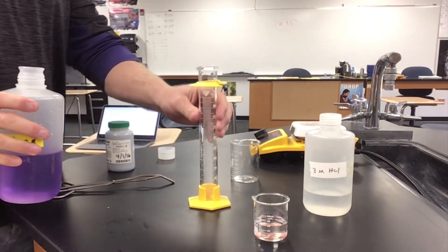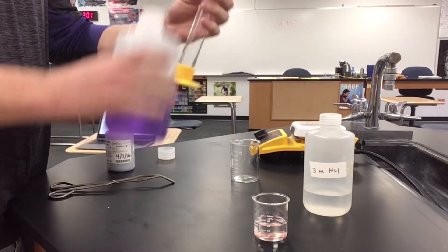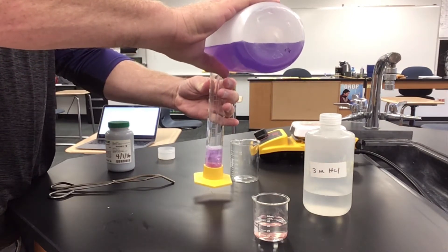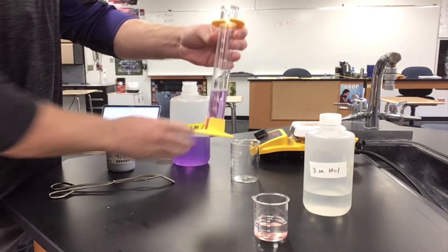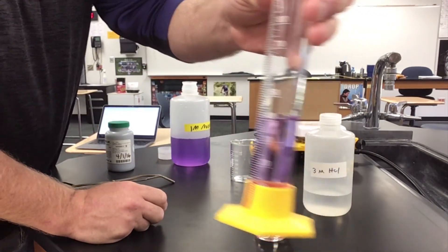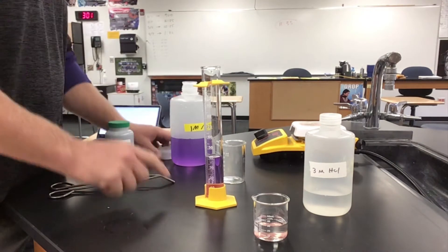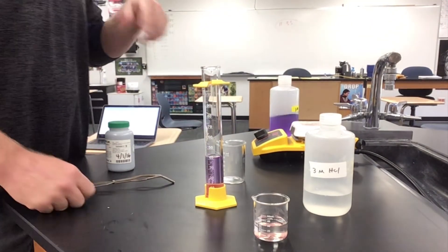I need 40 milliliters of this, so I'll be using a graduated cylinder to measure that out. This 40 milliliters is not quantitative in nature, meaning I do not need to spend a lot of time getting exactly 40. I got it pretty close to 40, and since this is not a quantifiable thing in this particular lab, I'm not going to measure it any more precisely than that.